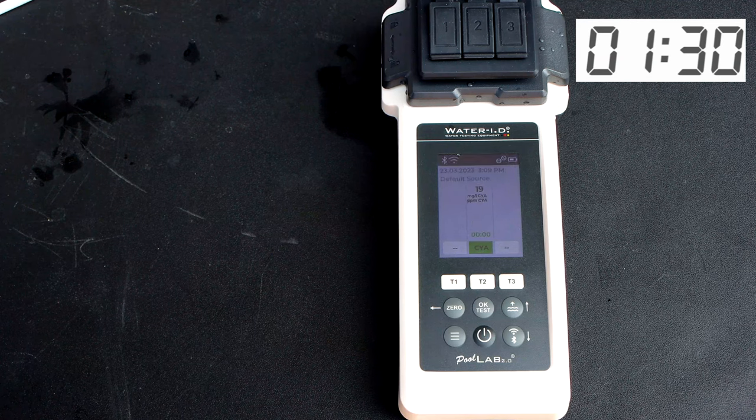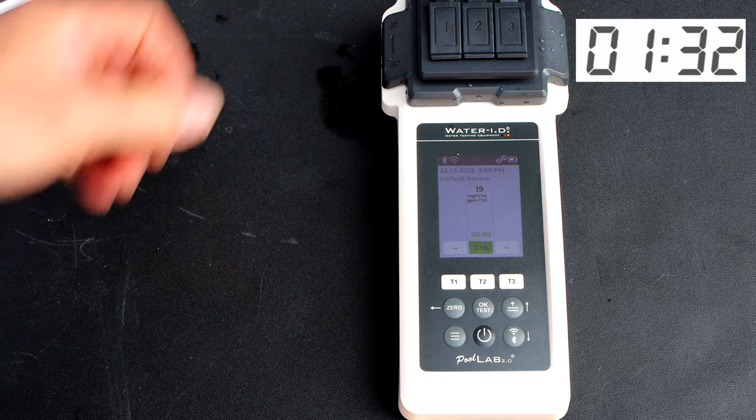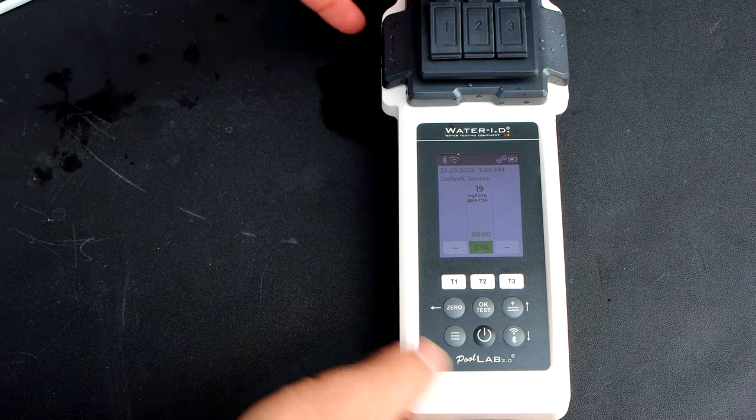The cyanuric acid level here is coming in at 19 parts per million.